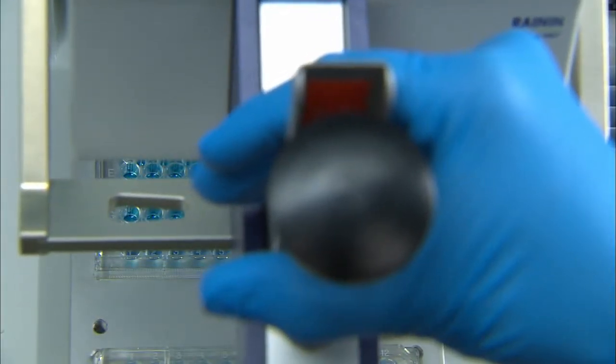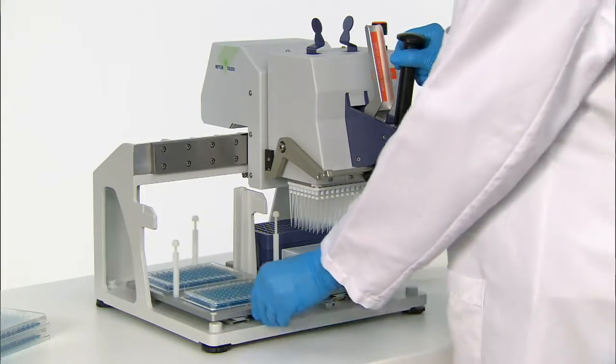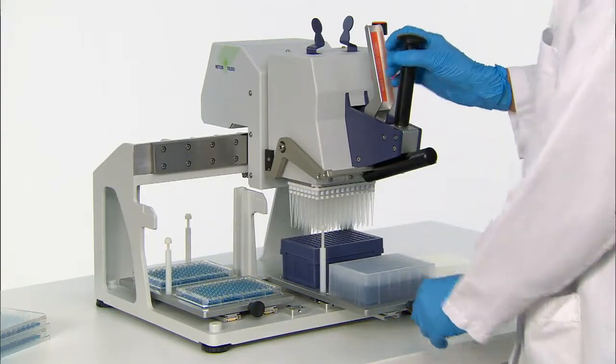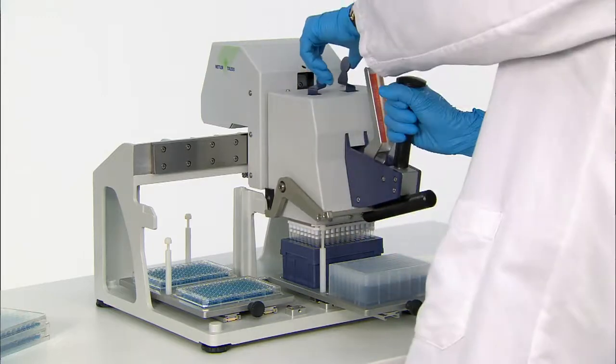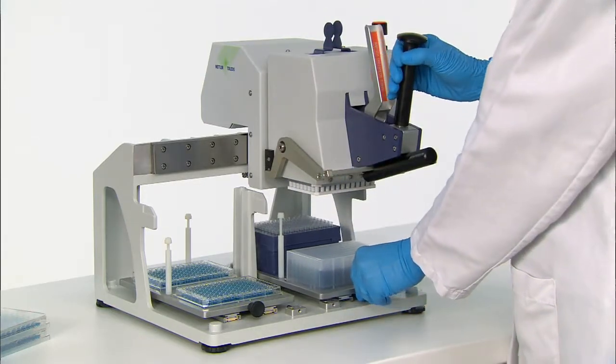Once the aspiration and dispensing cycles are completed, conveniently eject the used tips into the tip box by moving the liquid head and tip box back into position and squeezing the tip eject levers. The entire process is this fast and easy.